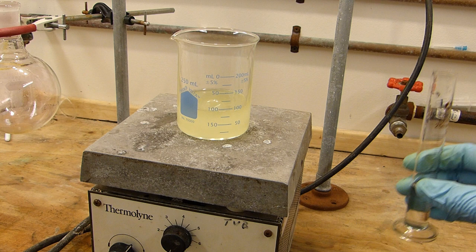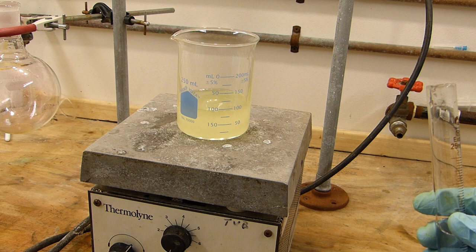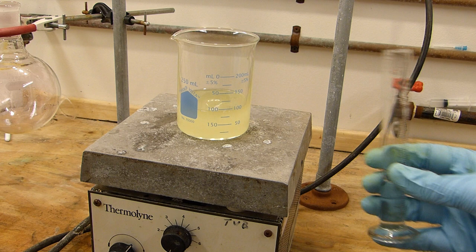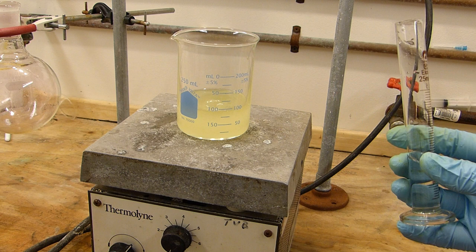So now that everything's dissolved it's time to go ahead and add the hydrogen peroxide. You can do this all at once. It's going to get quite warm and some iodine will escape into the room as purple vapor. That doesn't really matter too much in this reaction. We have quite a bit of volume here to absorb that heat energy. That's what all that water is for in the beginning, and it doesn't really contribute to much loss of yield.